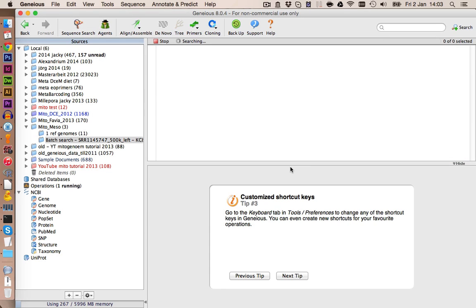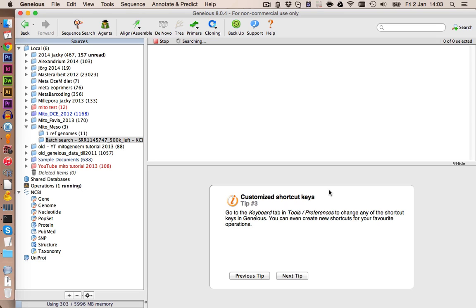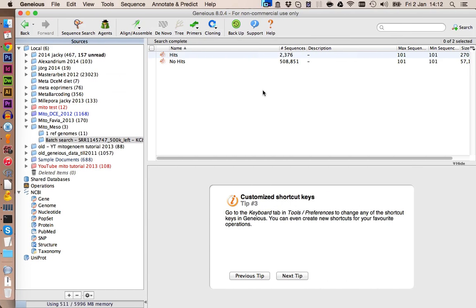And now we see it starts the search. This will take a few minutes. It warns us here that some reads have ambiguities, but we can't really do anything about it, so we just click on OK. So here's starting the BLAST search, and I'm just going to fast forward and we see what we get. So we got our results back and we have around 2000 hits. Let's get our mitochondrial reference genome in here as well.